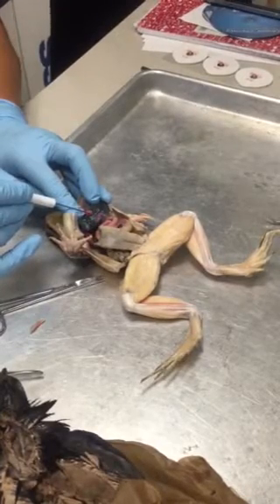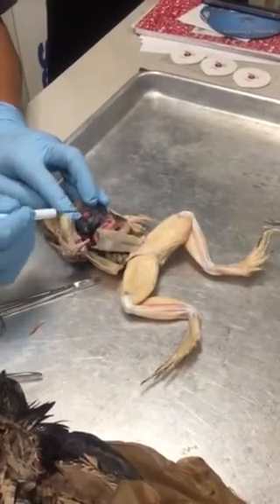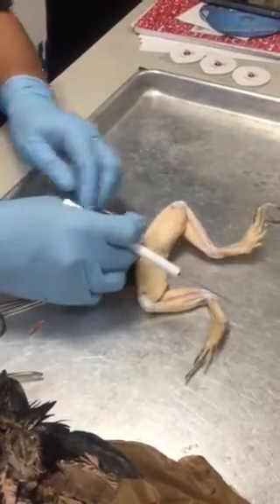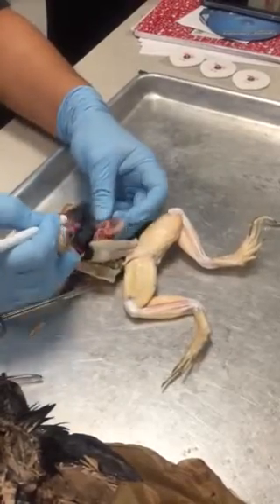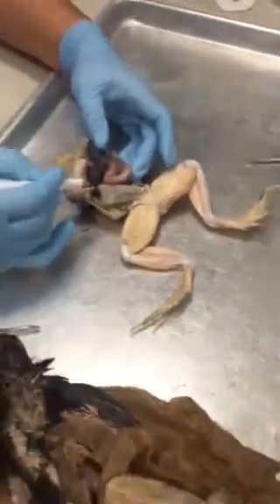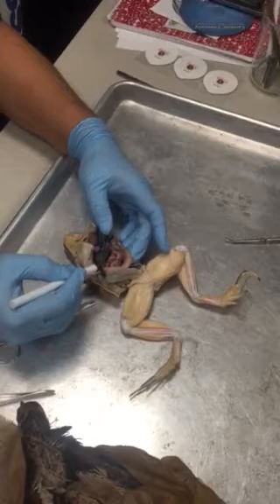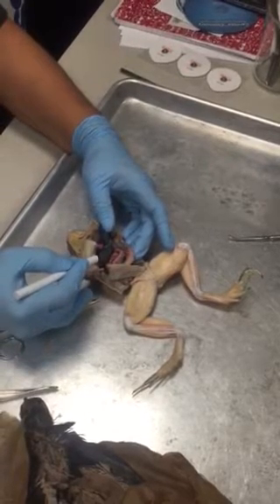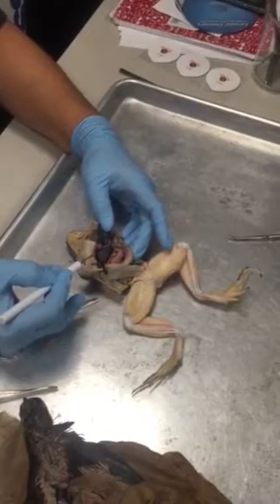This is the hepatic artery. It's going to the liver. Okay? If we follow this intestinal tract here, or digestive tract, we see that there's the stomach here, and there's a pink artery going to the stomach, that's the gastric artery, and a blue vein coming from the stomach, that's the gastric vein.